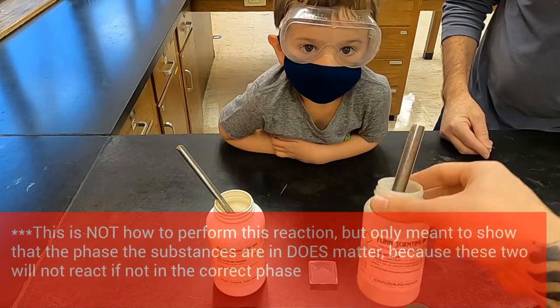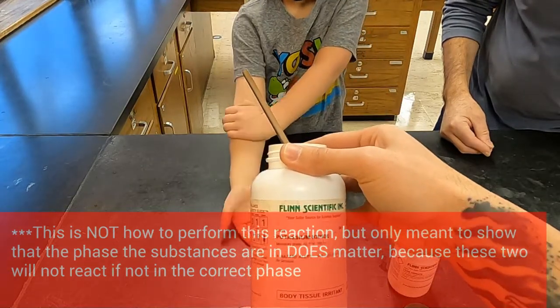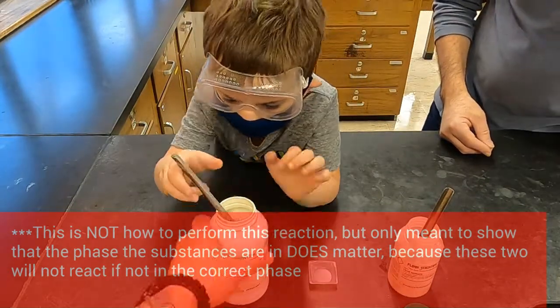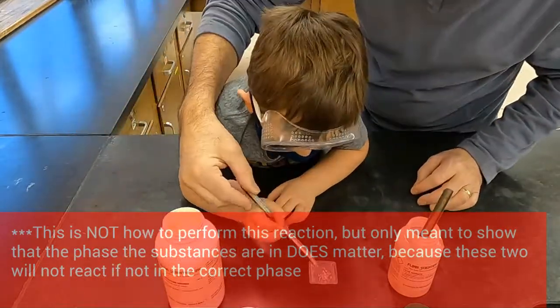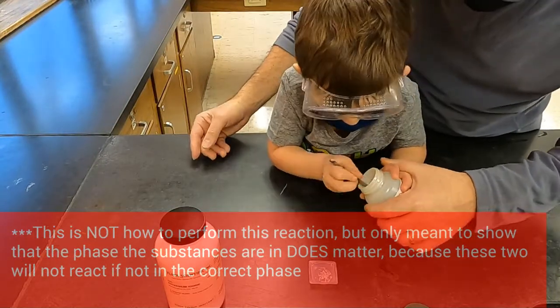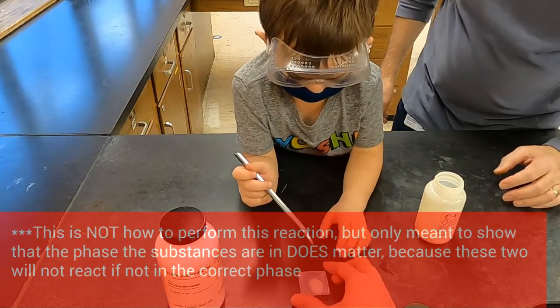Now this procedure that you're looking at right now is not one that you are going to do in the lab. We're trying to show the importance that the phase of the substances has on whether or not they will react. This is a reaction between these two chemicals, that's true, but it's important that the phase is correct, that they are dissolved in water when they react. And you can see that just putting the two powders together does not do anything.